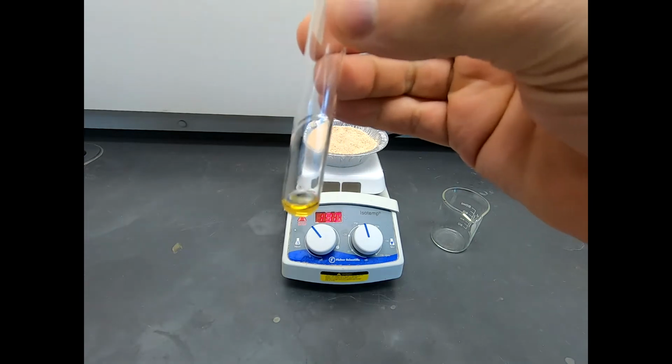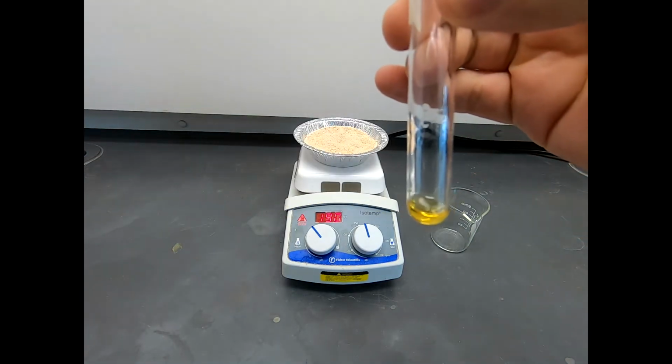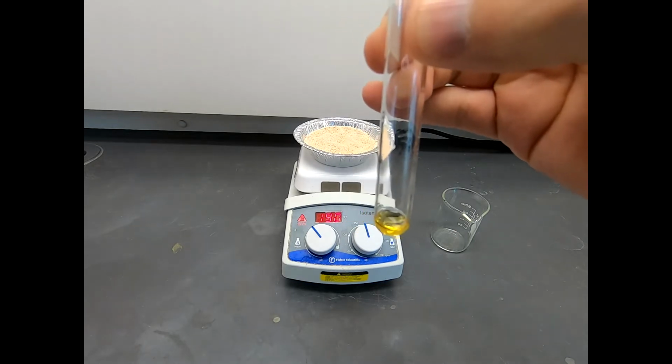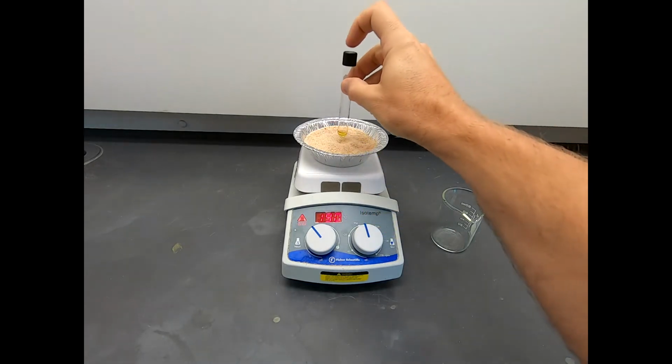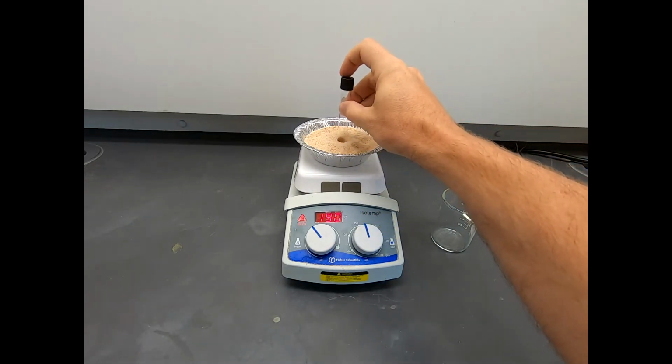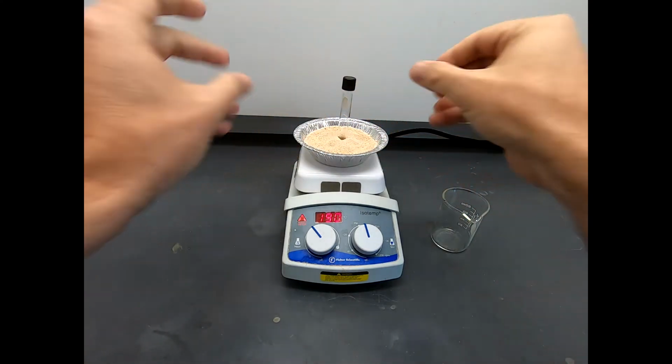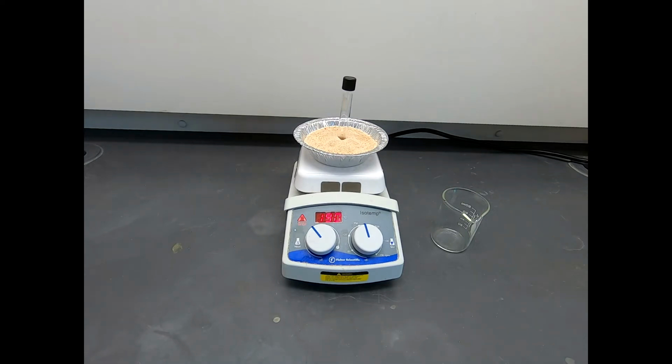And notice that everything has melted in. There is no solid in there. Everything is a nice uniform color. It's a homogeneous reaction, and that's what we want. So everything's in one phase. It's mixing. There's no solvent in this reaction. This is technically called a neat reaction when there's no solvent. So this reaction hopefully is almost complete, but we'll give it another half an hour, and then we'll stop it and we'll go to the next steps of the reaction.